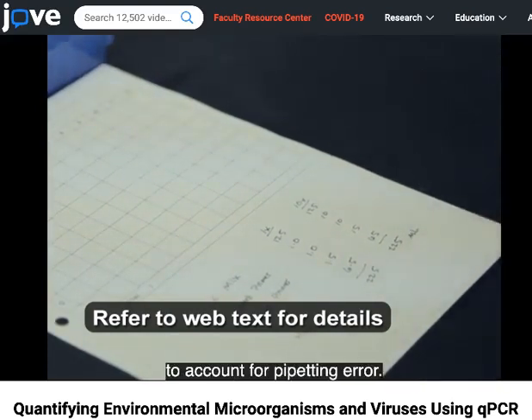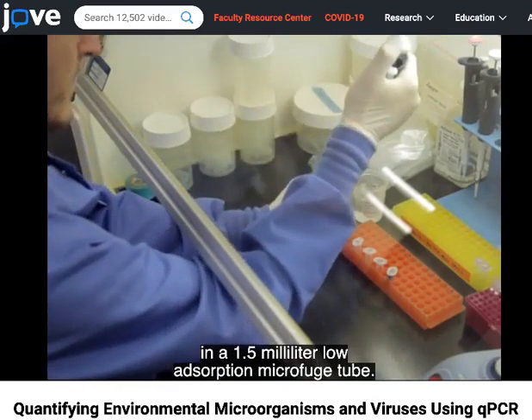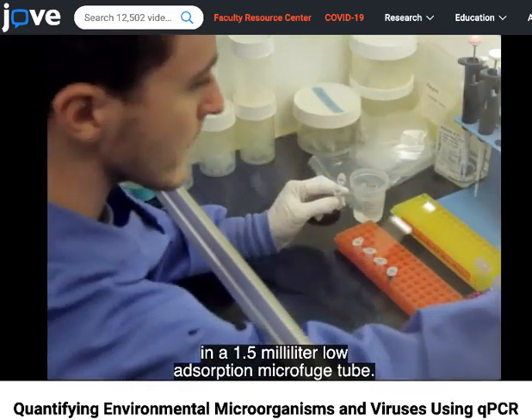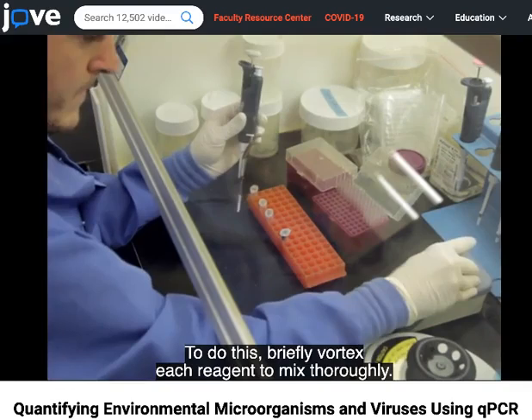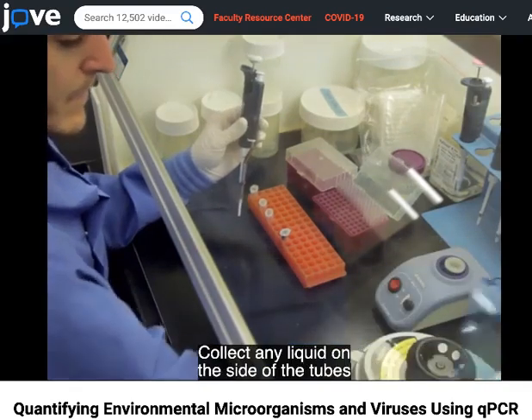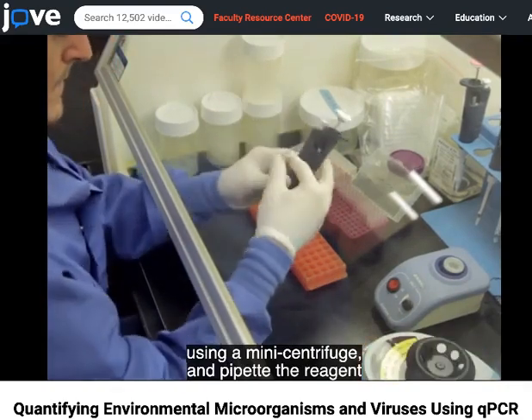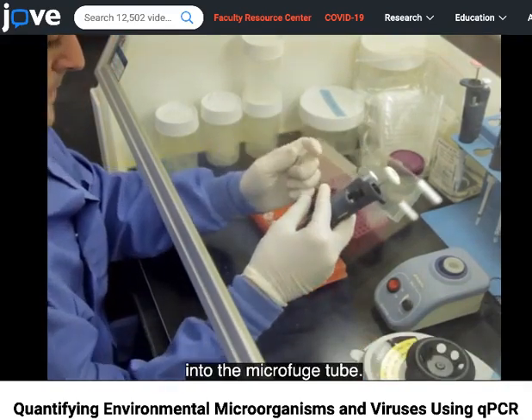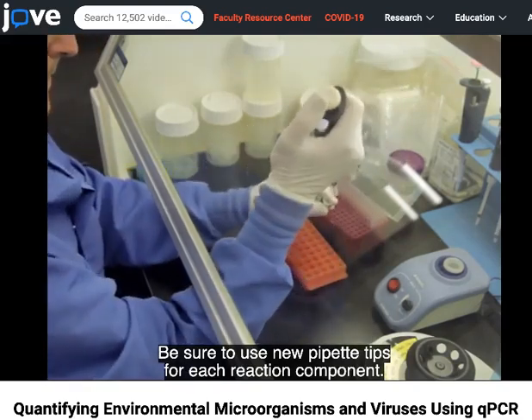for pipetting error. Once the reagents are thawed, assemble the master mix in a 1.5 milliliter low adsorption microfuge tube. To do this, briefly vortex each reagent to mix thoroughly. Collect any liquid on the side of the tubes using a mini centrifuge, and pipette the reagent into the microfuge tube. Be sure to use new pipette tips for each reaction component.